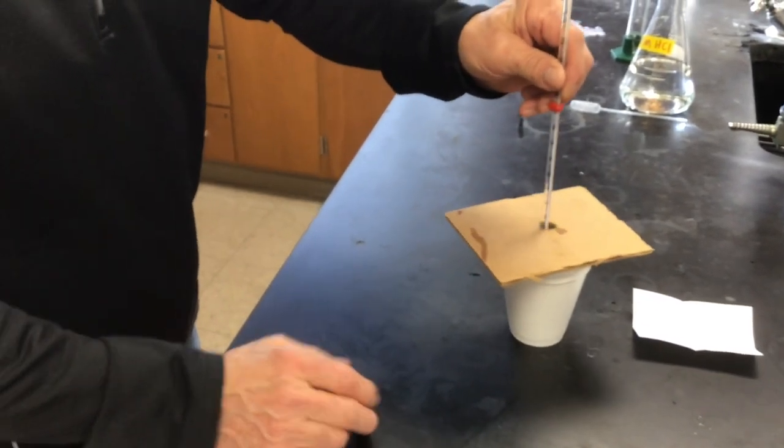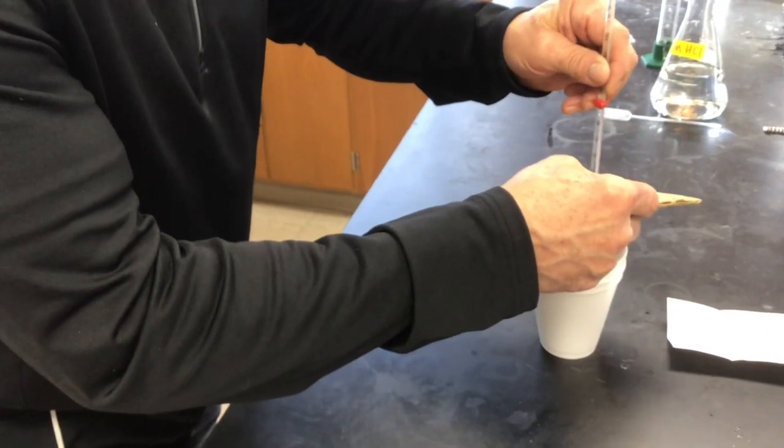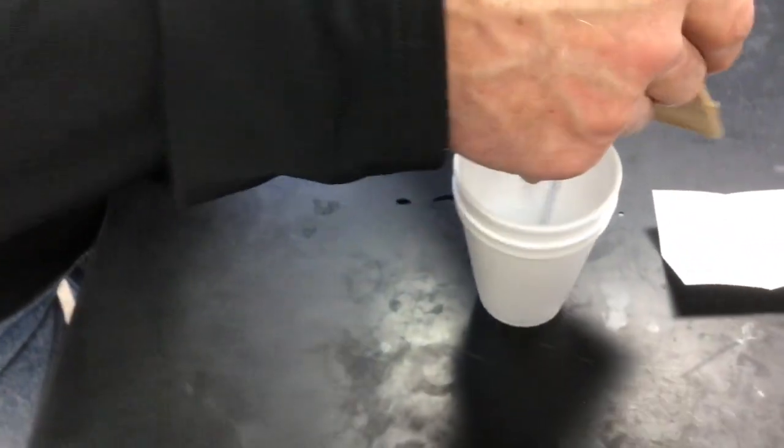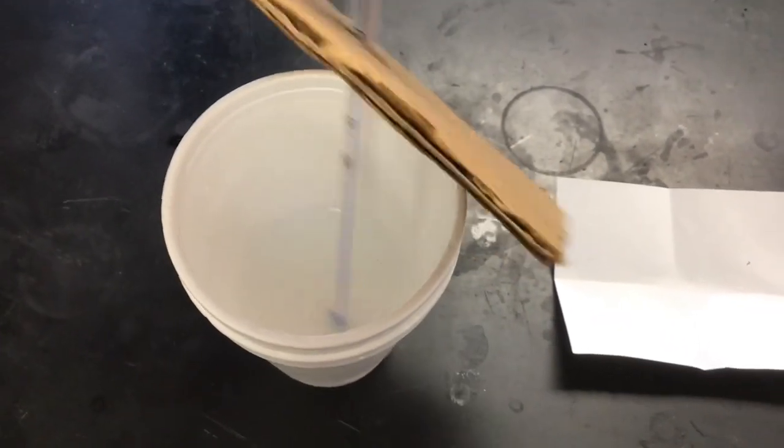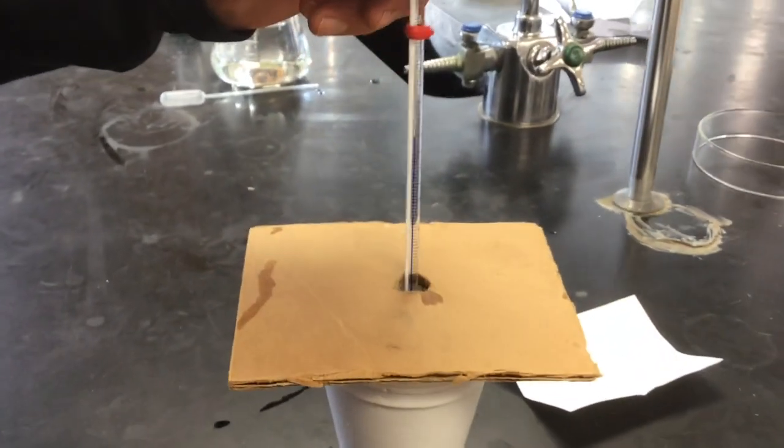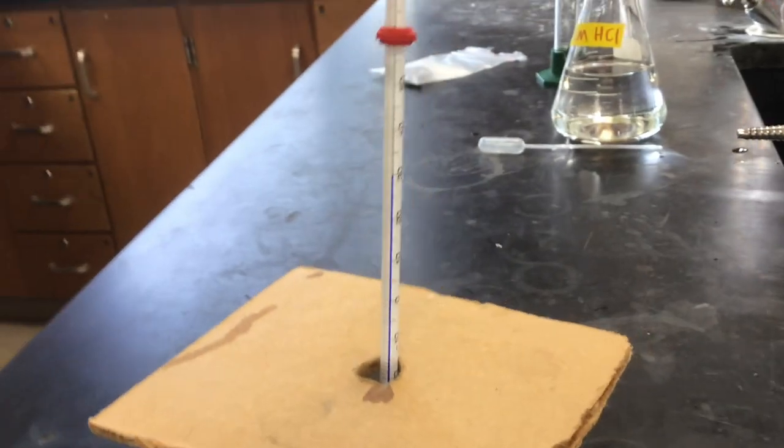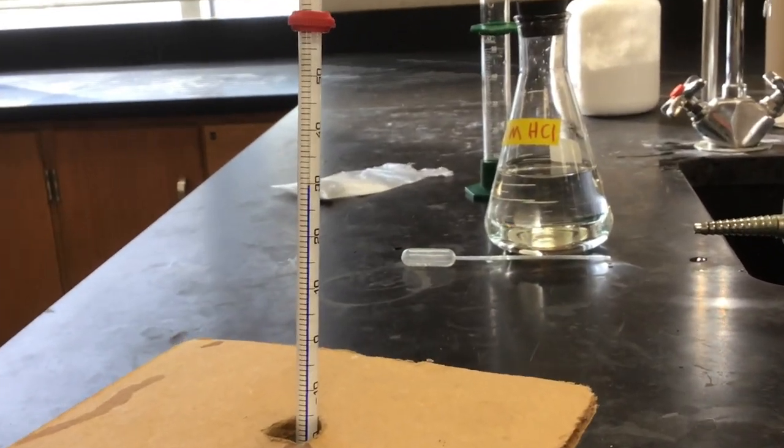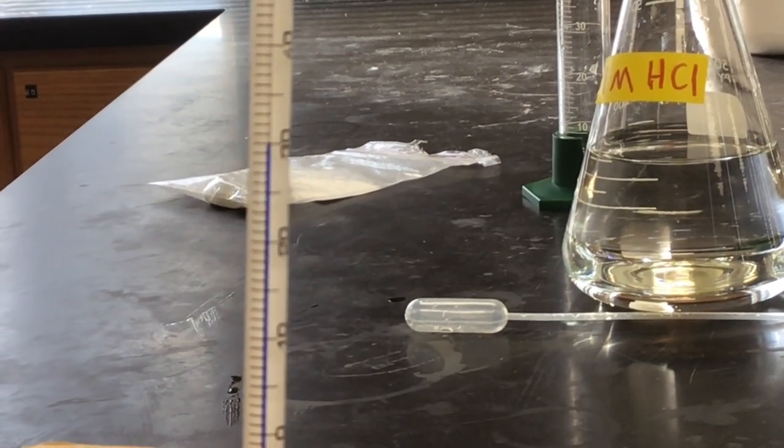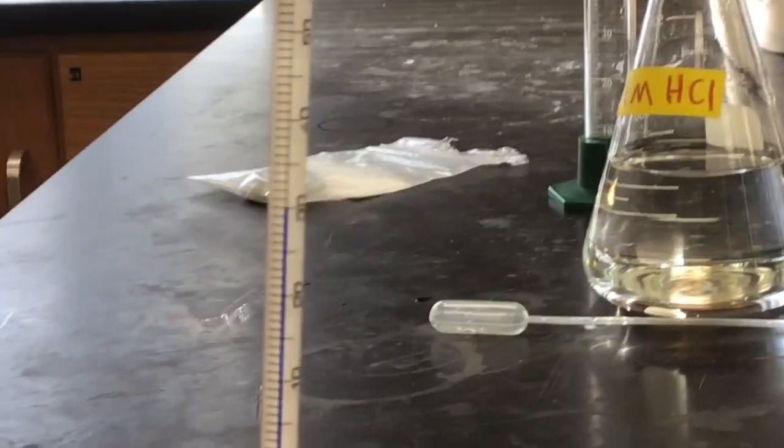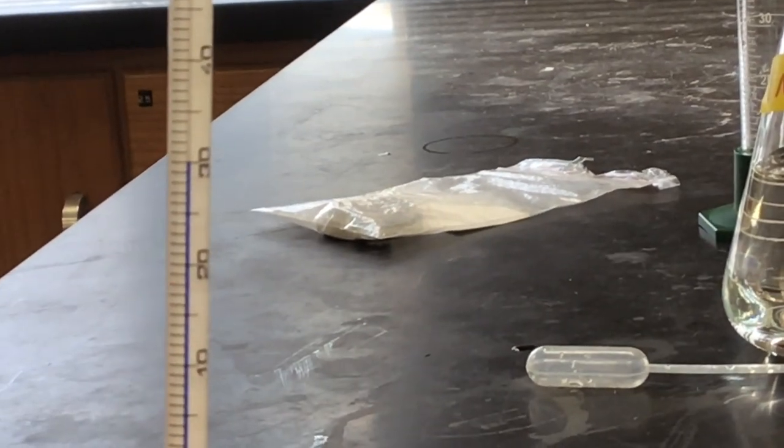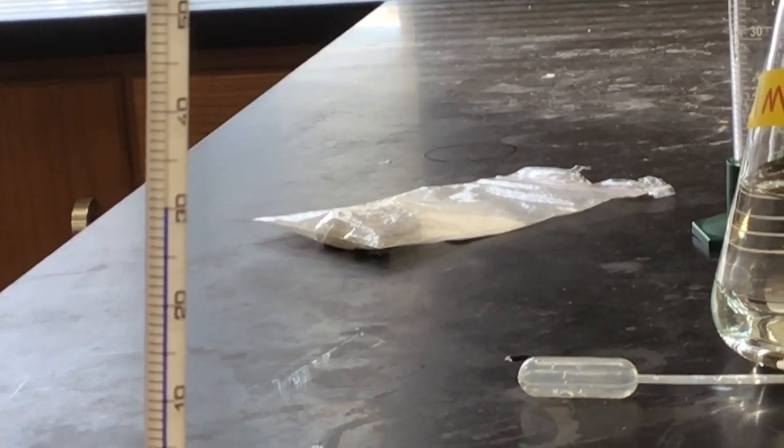This reaction is not as dramatic, is it? We don't have the hydrogen gas generated. Everything pretty much just stays in the cups. What do you see happening there? Is most of the solid all dissolved away? Yeah, I think so. It's a little hard to tell. It is hard to tell. But we're looking for the temperature to stop changing. It looks like it was still going up, but I think it has stopped going up. All right, final temperature.